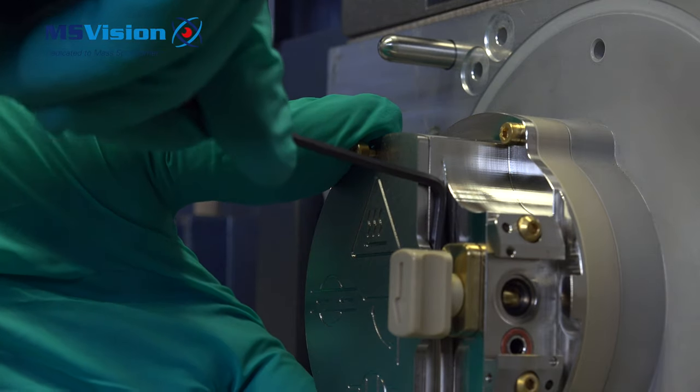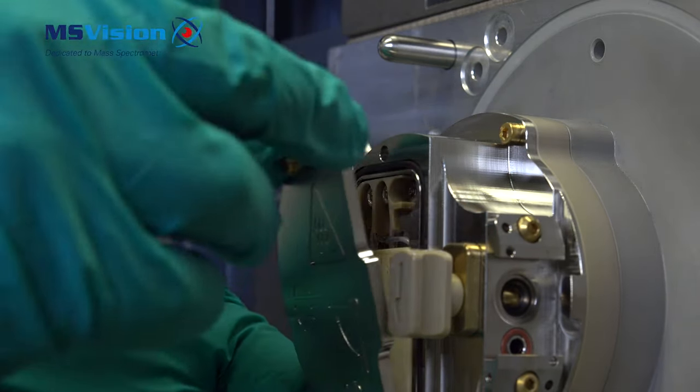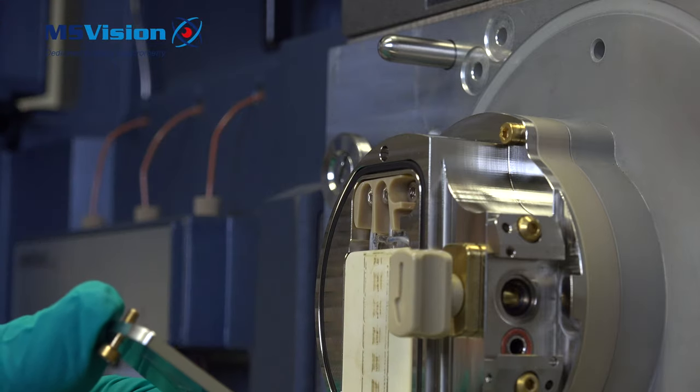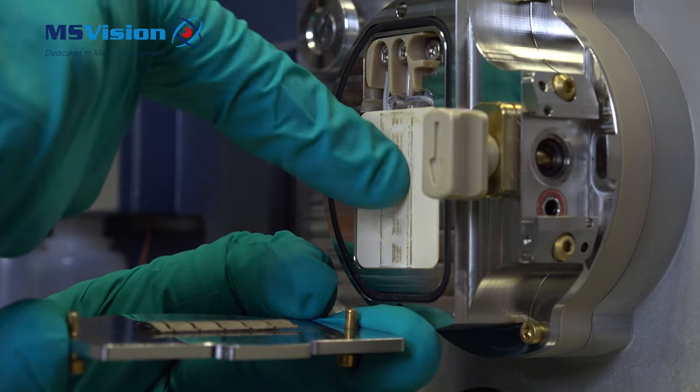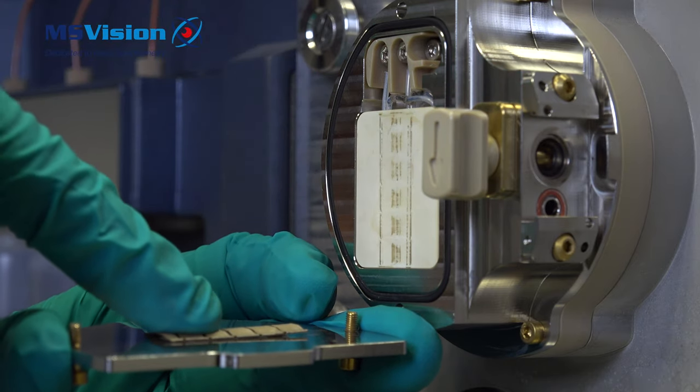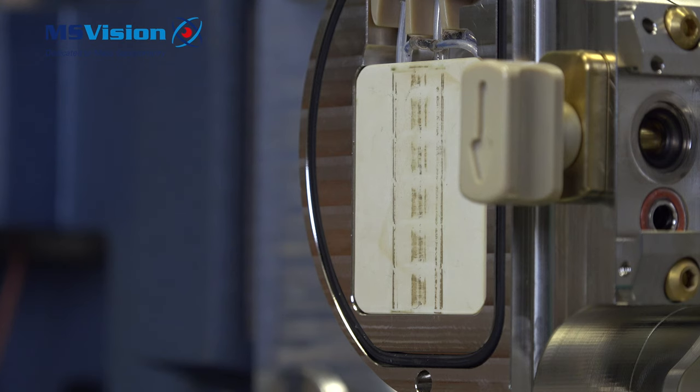If the heater plate is tight, then use your allen key to remove. This here presses between the heater element and the front plate. It always is loose, but originally was stuck to the element.